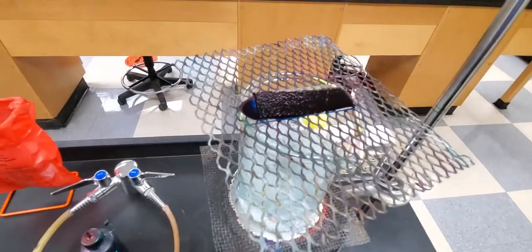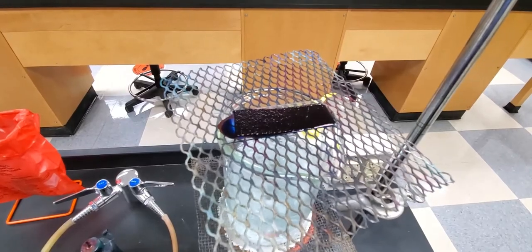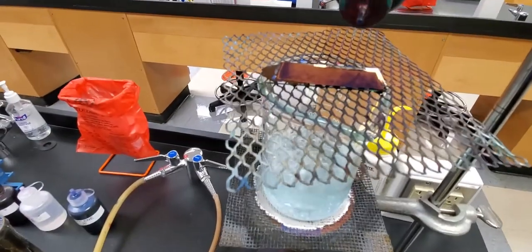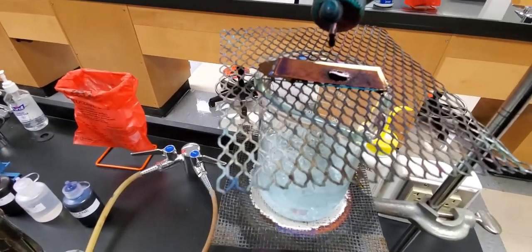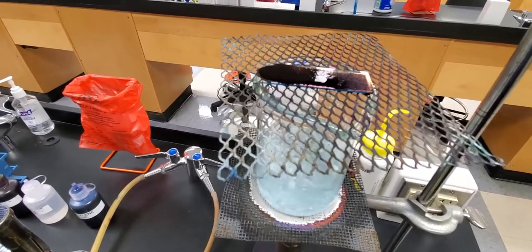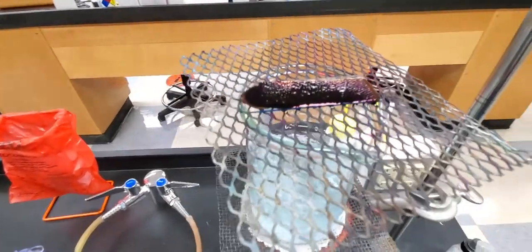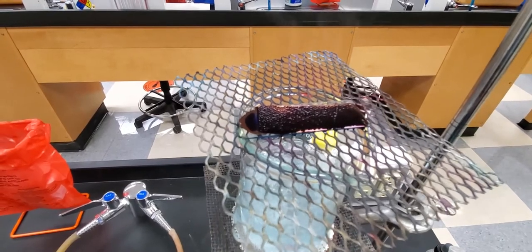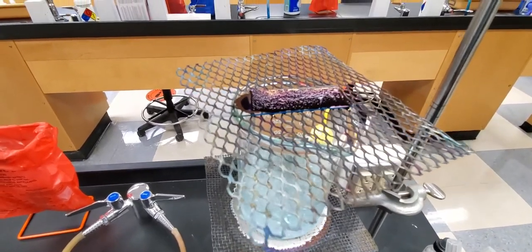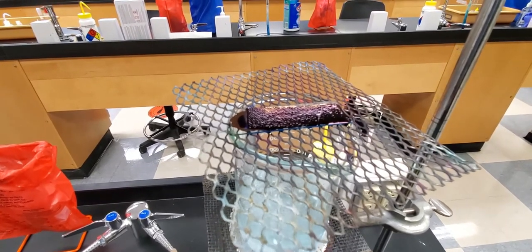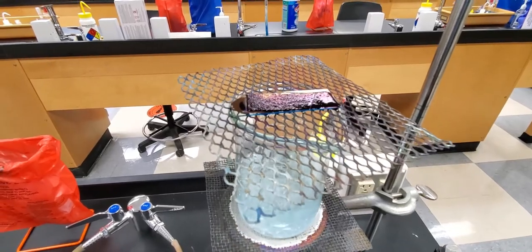You can see that our endospore stain is starting to dry out a little bit on top, so we apply a little bit more of that dye. That paper towel again helps to keep it moist right there, so we just want to keep adding that over this time period. It's been about a little over five minutes at this point, so we want to make sure that we keep administering that dye to allow those cells to stain.